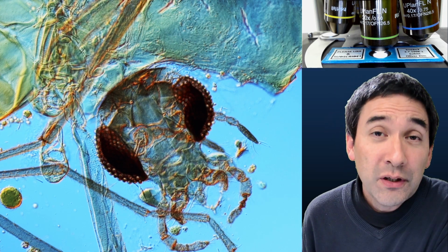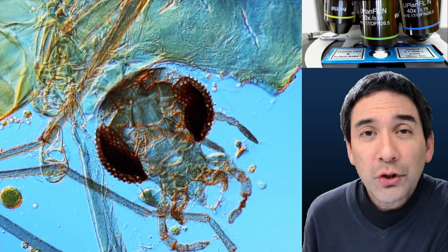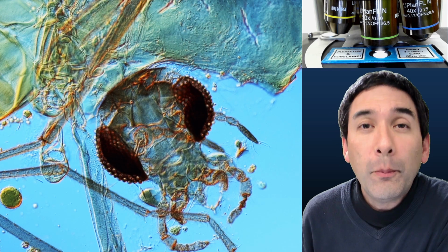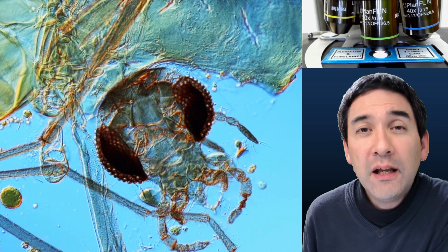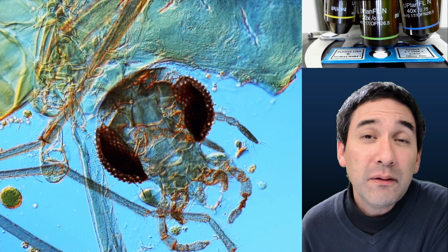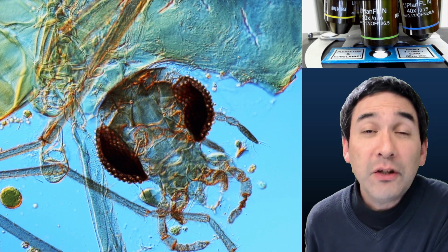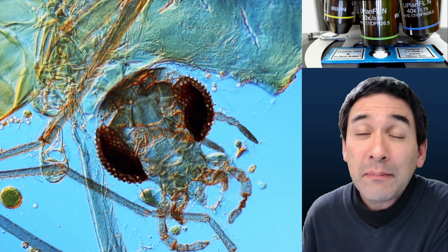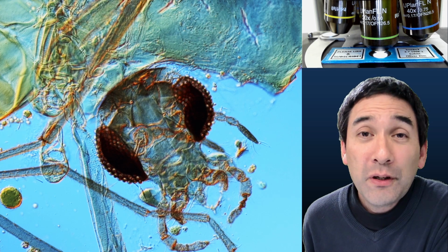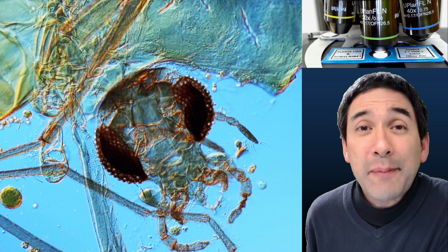And that's really important because the insects or specimens that still contain water are prone to decomposition. So bacteria and fungi will actually start to break down the specimen. And essentially, if you remove the water, you can also simply air dry the insect and then mount it. It's also better if you put it into alcohol, and this will also remove the water, and those dehydrated specimens are much more stable.